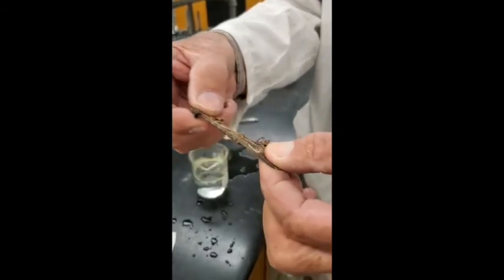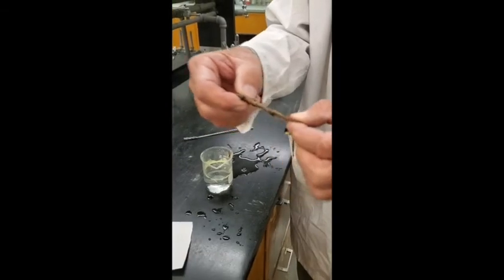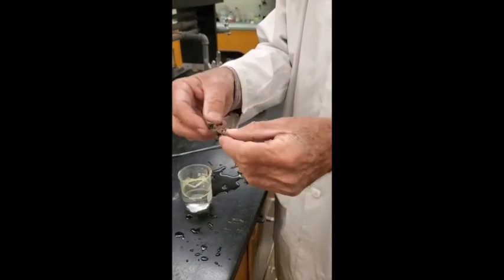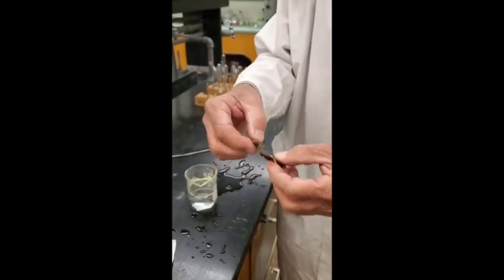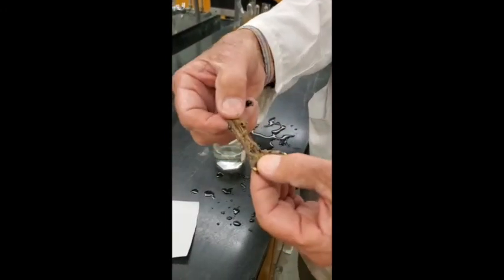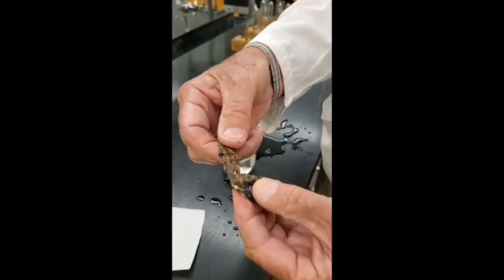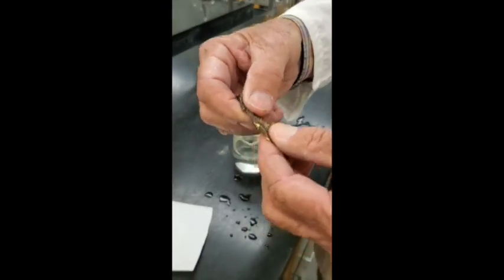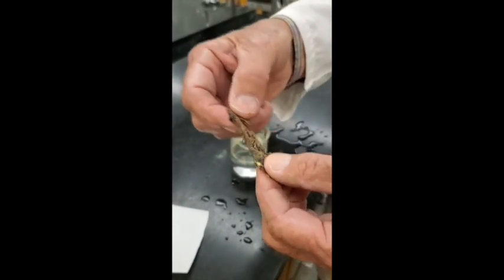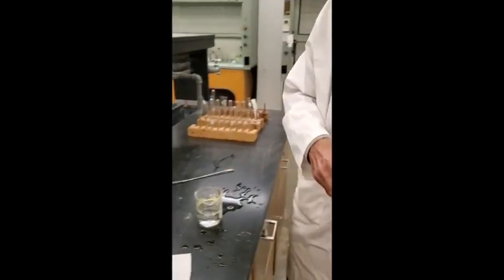Can you see it stretching? Isn't that something? It's really rubbery — that's remarkable. And if you let this stand, it gradually changes back into rhombic sulfur. Can you see it's starting to get a little orange — or yellow? A little bit of yellow color; it's already changing. Once it changes back, it's no longer rubbery. That is remarkable. And that's a good place to quit.